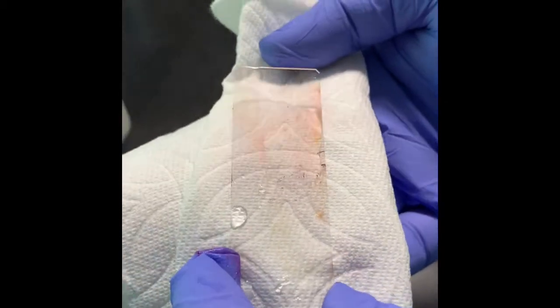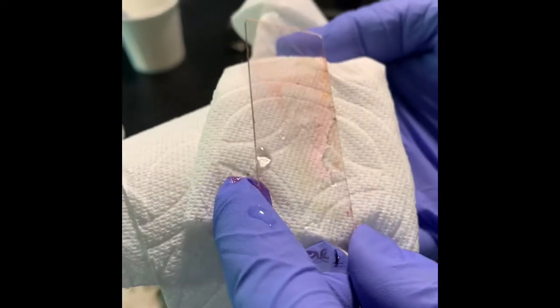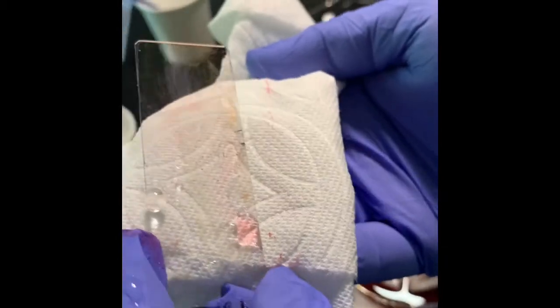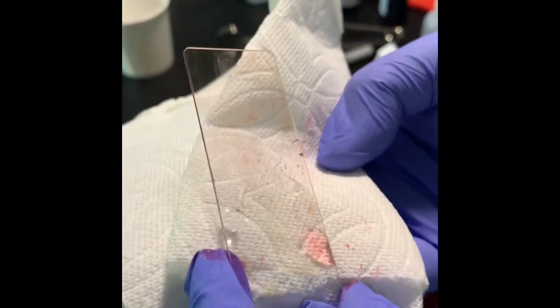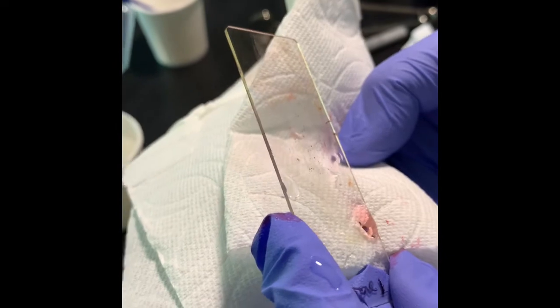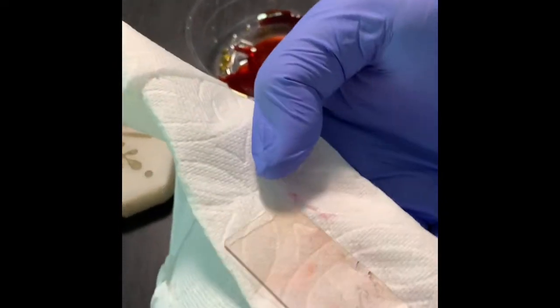When you look in the microscope, we can see that for some people it is a little bit purple, for some people it is reddish, but it doesn't mean anything. If I'm getting reddish over here, it doesn't mean that my cells are gram negative, because in the microscope, unless I see in oil, I cannot say what it actually is.